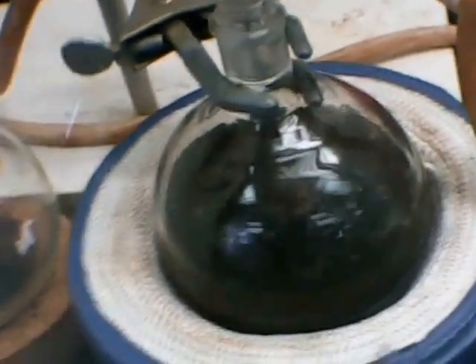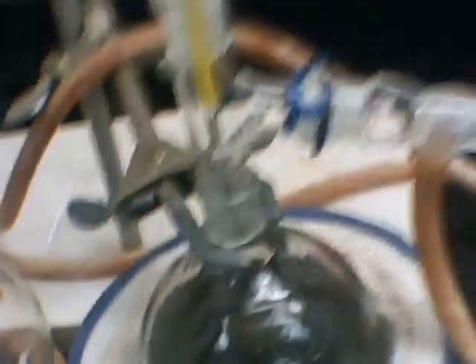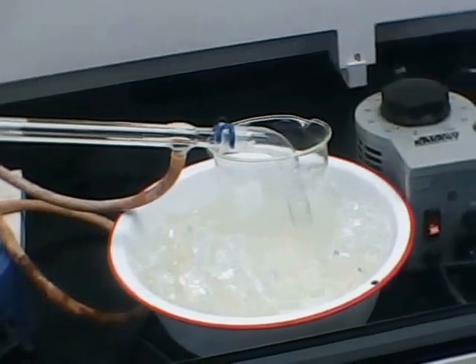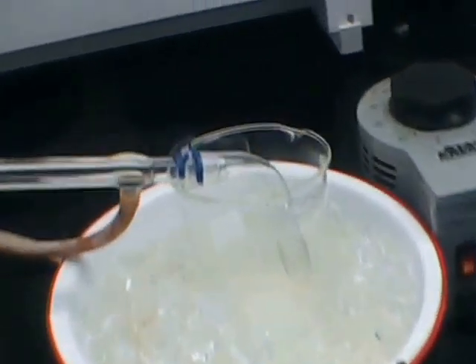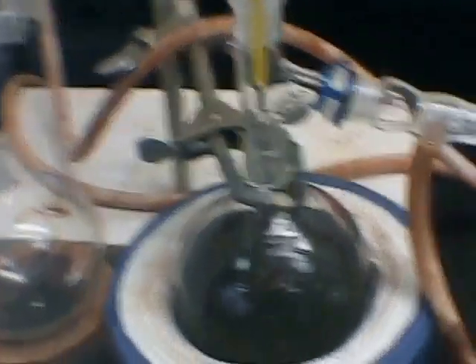But I wanted to distill it. I'm going to have my students do this in a fuels lab. So I'm doing a simple distillation here in the fume hood. I've got a nice bath.